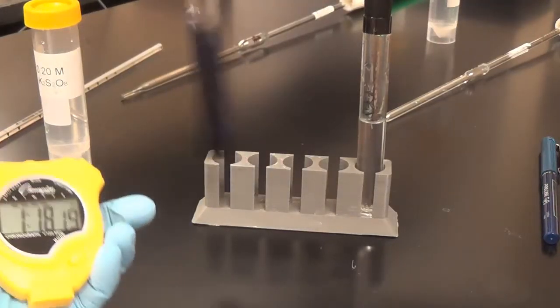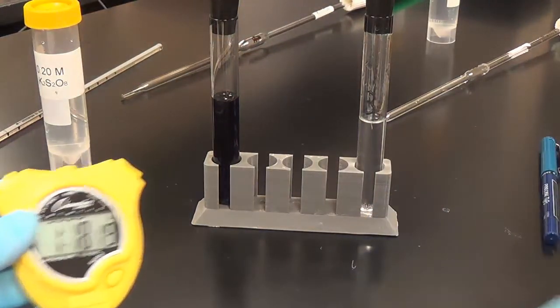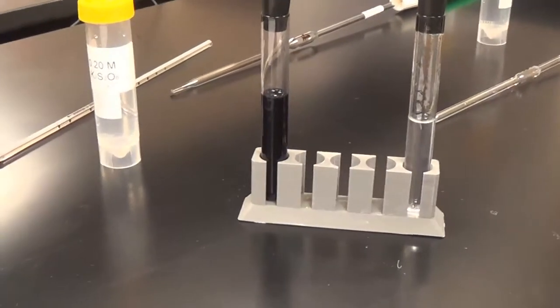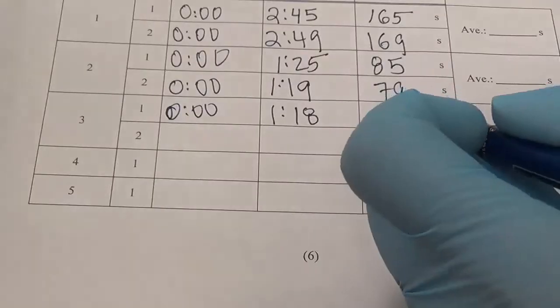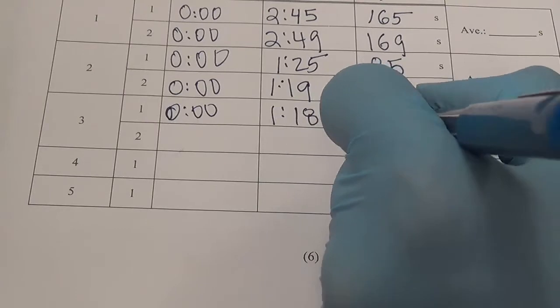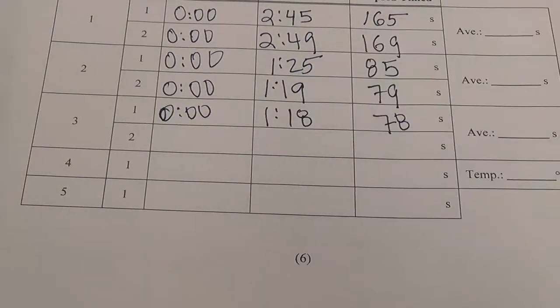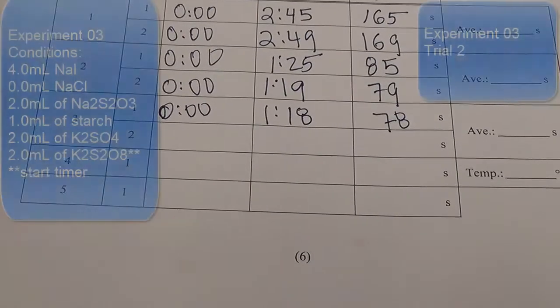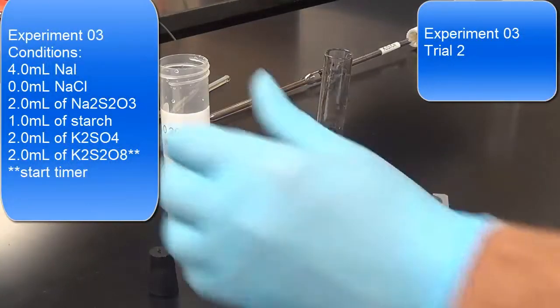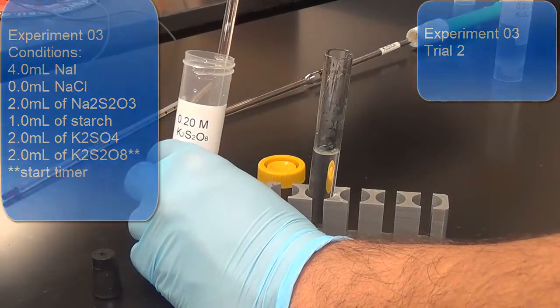Let's stop there. And 1 minute and 18 seconds. So let's go back here to our data table. In my head, I'll convert that. That's about 78 seconds. We can take the averages later. All right, now we're going to do our second trial for experiment 3. So our duplicate, our second run for experiment 3 in those conditions.